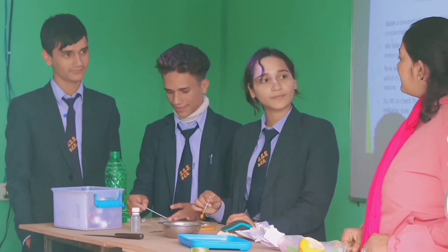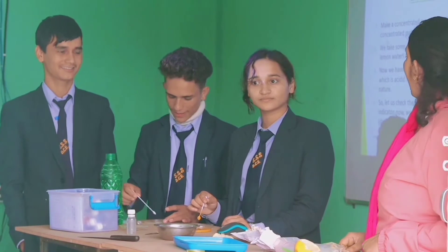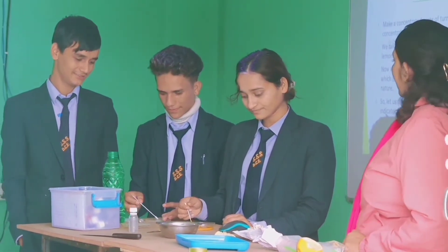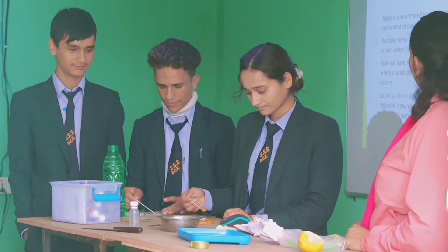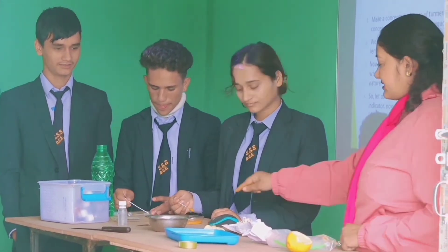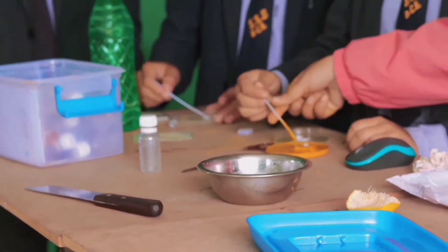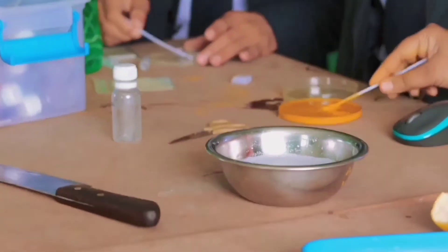For this experiment, Niran, Jilendra, and Kuspa are invited. First of all, make a concentrated paste of turmeric powder in the petri dish. Our concentrated paste is now ready for use as an indicator.